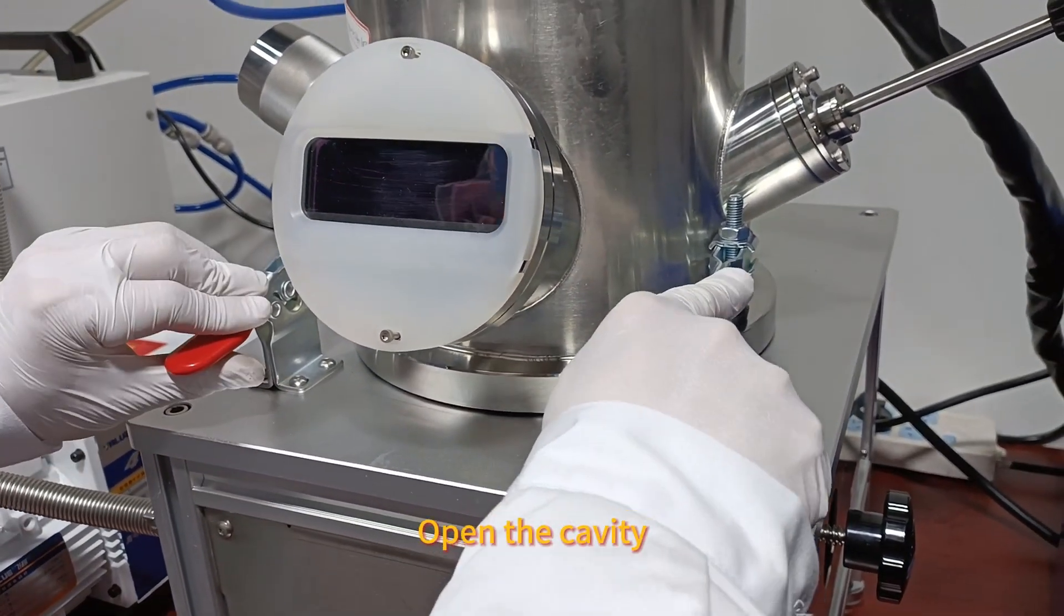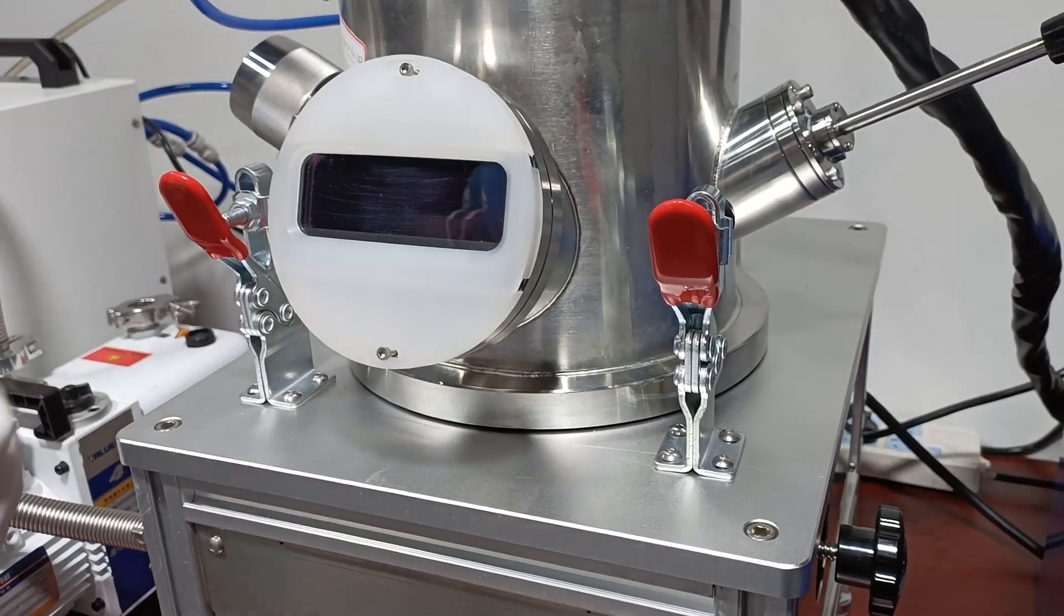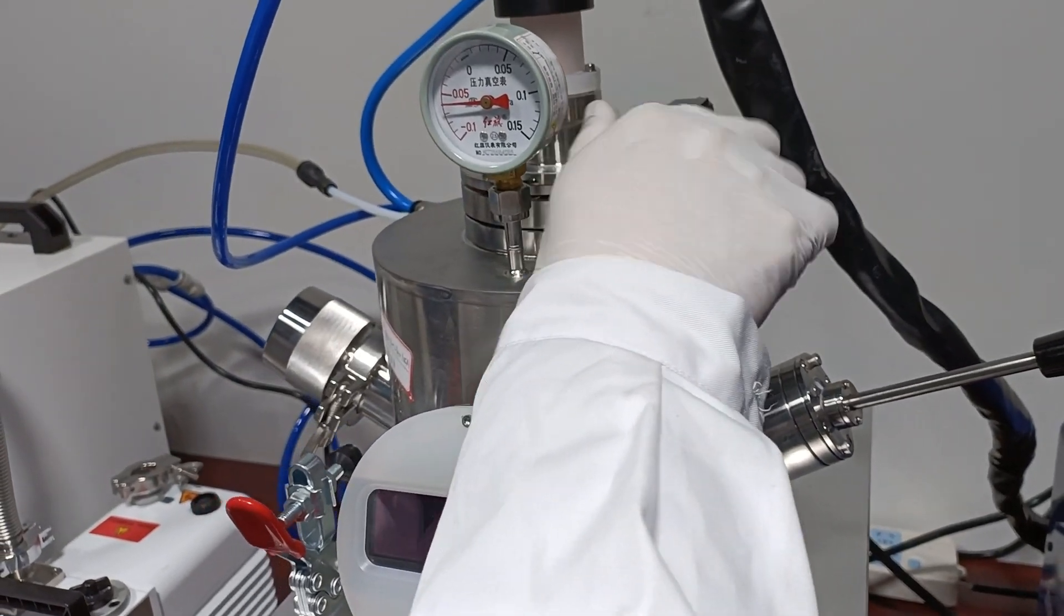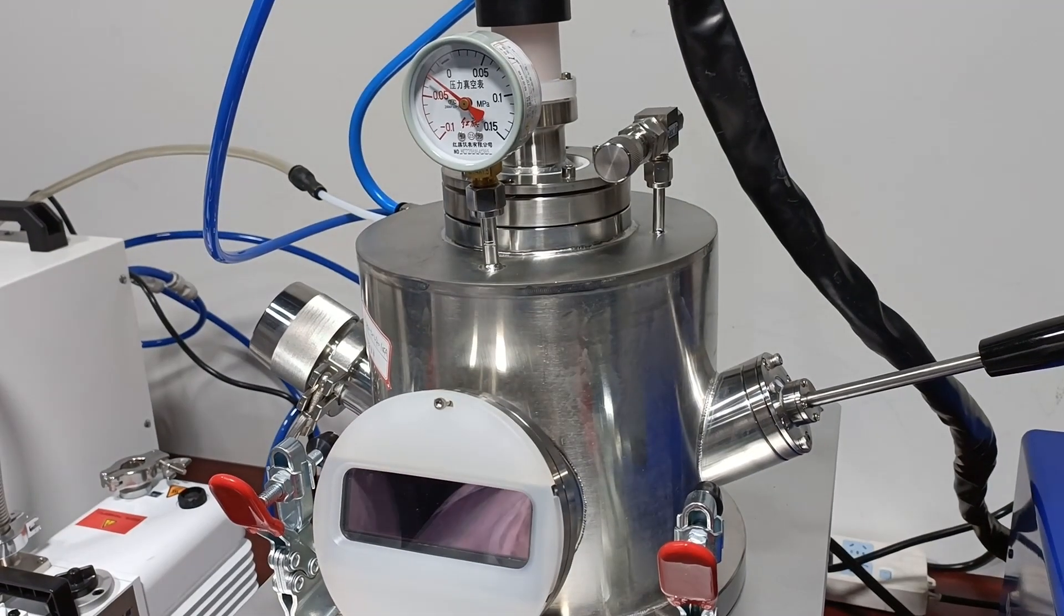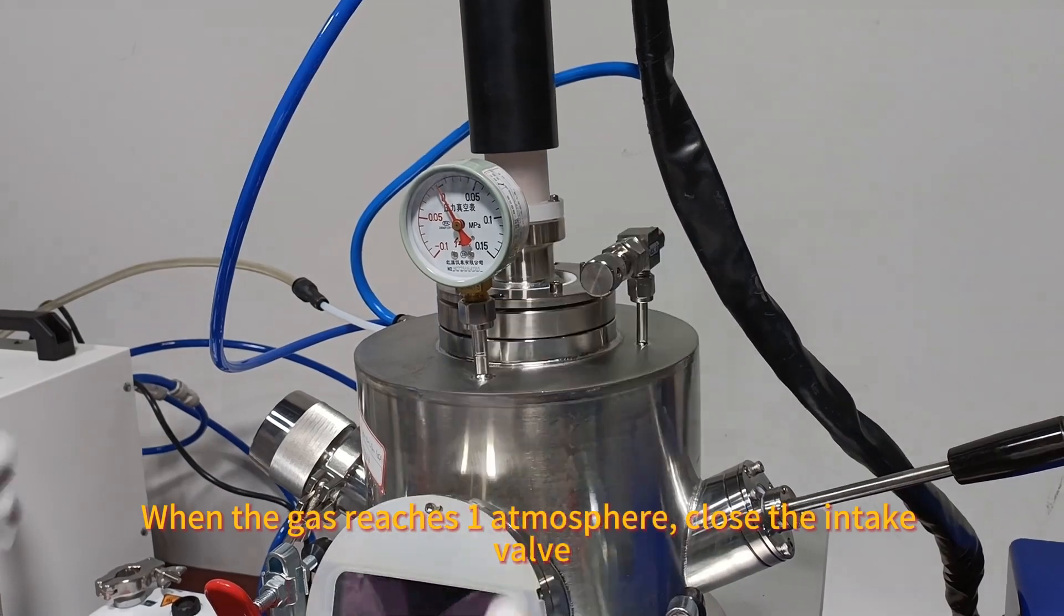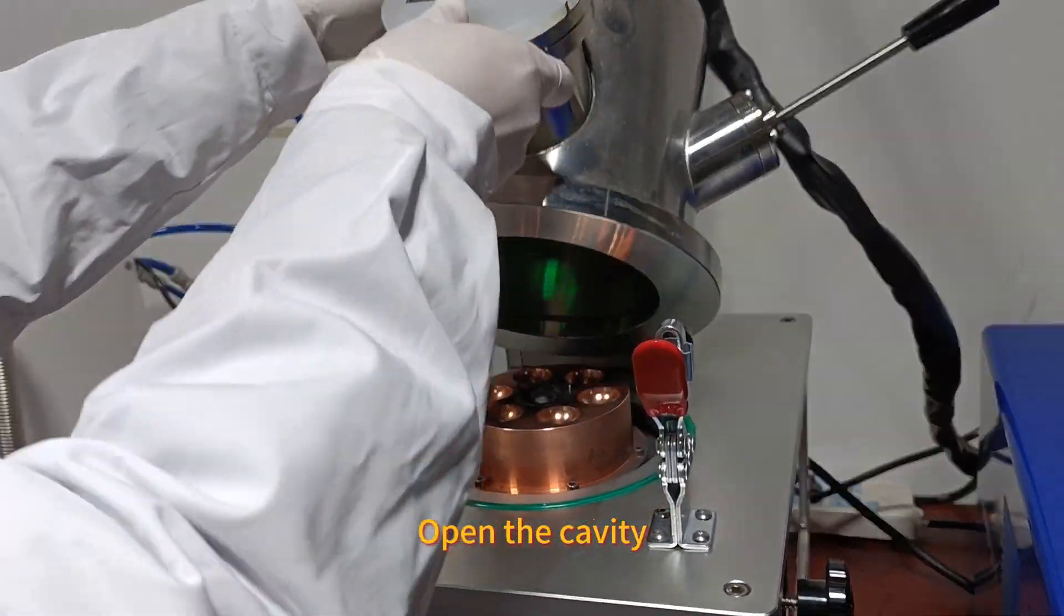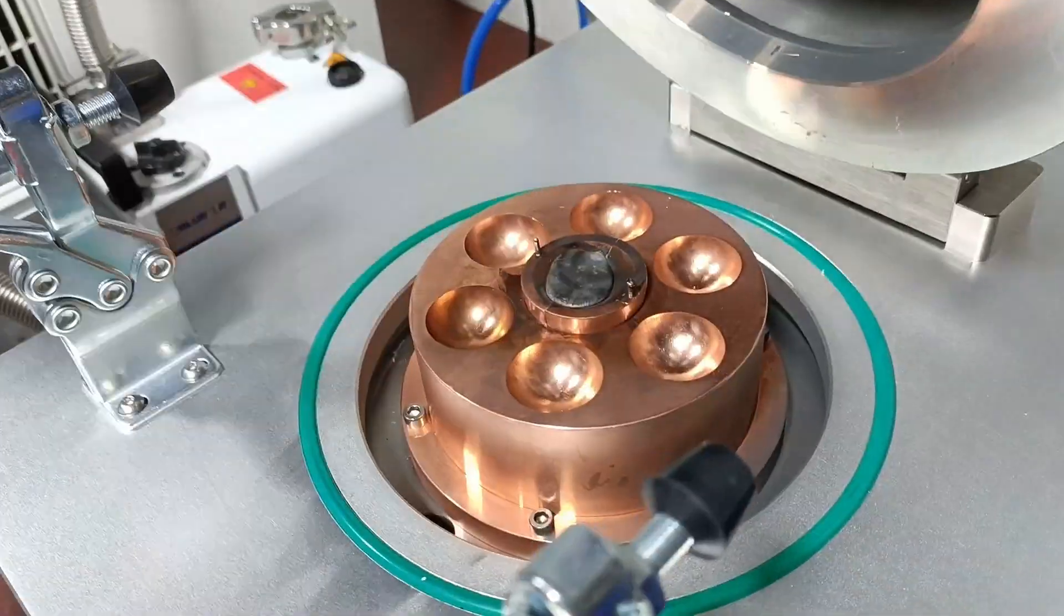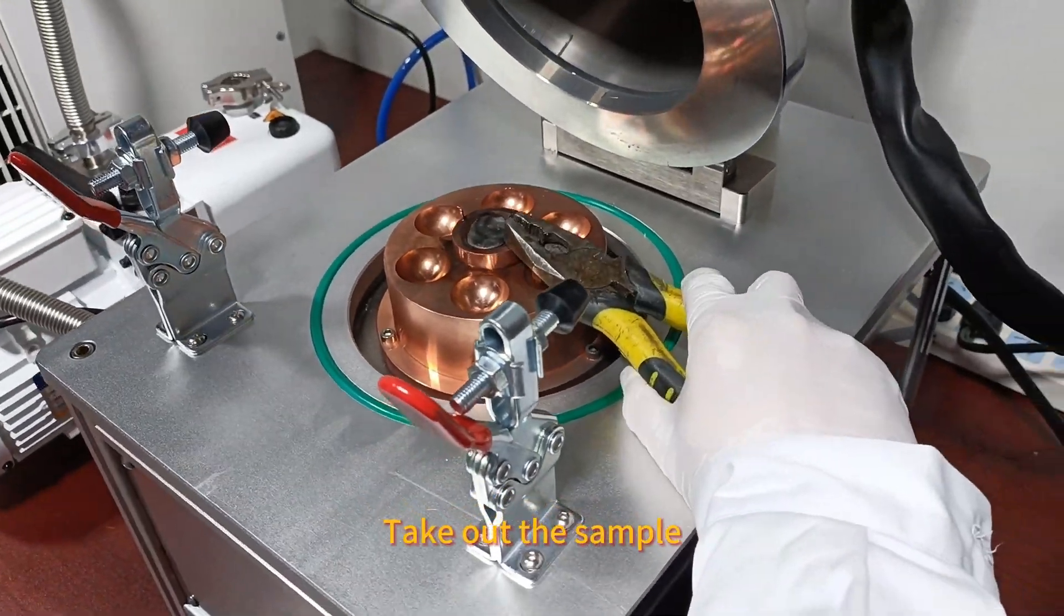Open the cavity. Air intake. When the gas reaches the atmosphere, close the intake valve. Open the cavity. Take out the sample.